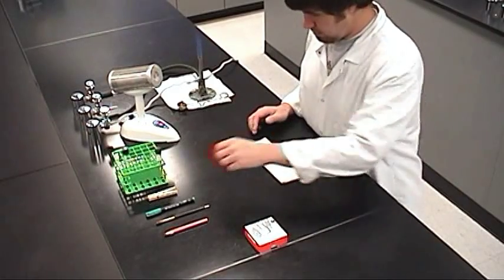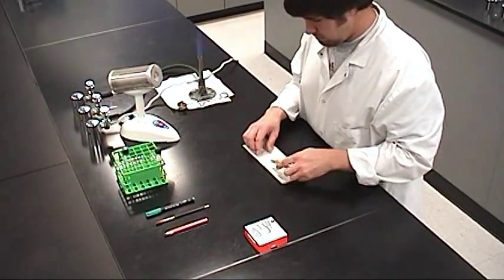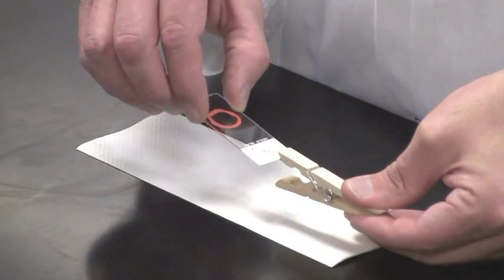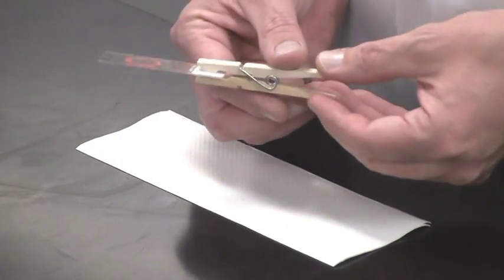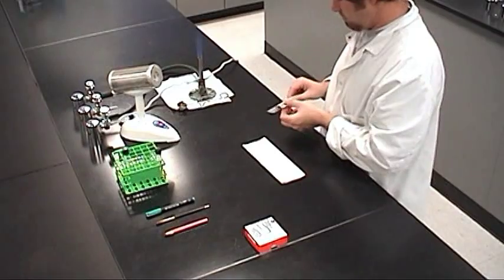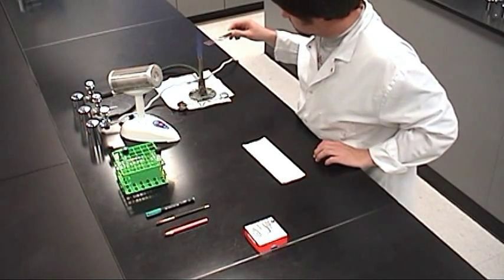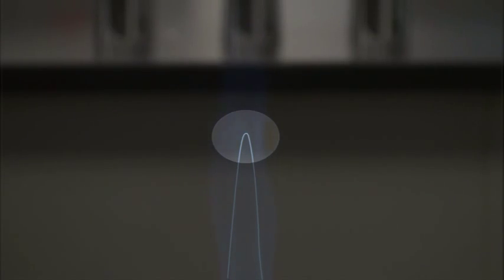First, attach the slide holder to the slide. Pick up the slide and clamp the slide holder to the frosted end of the slide. Supporting the slide by its holder, pass the smear in and out of the Bunsen burner flame, at the top of the blue cone, the hottest part of the flame, for 1-2 seconds per pass.